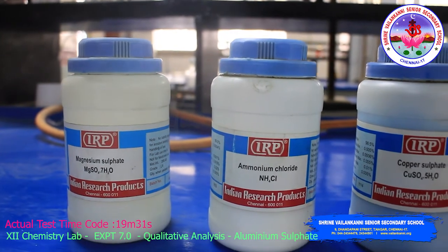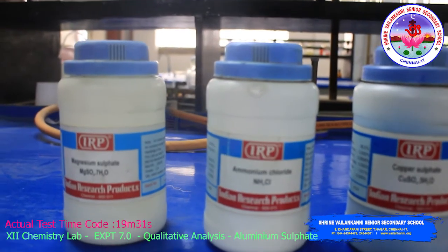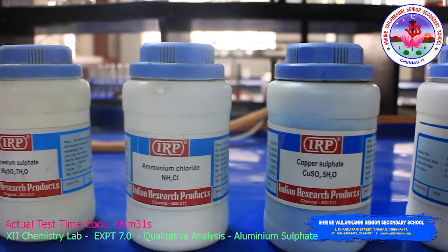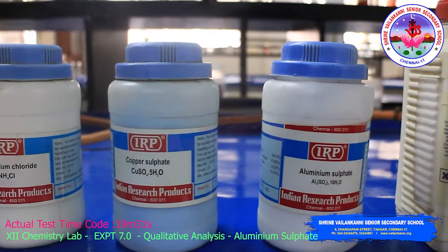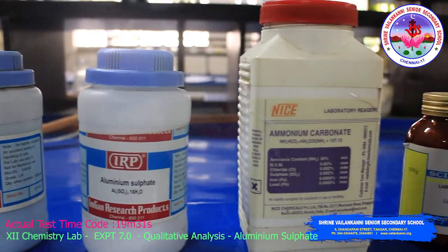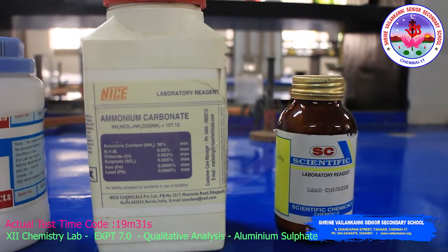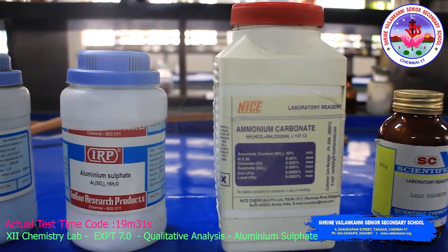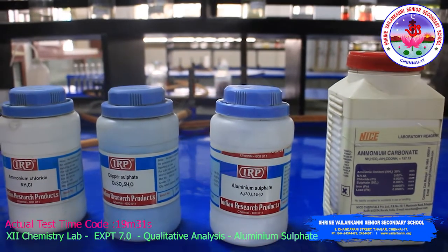Here we are going to do these salts this year: magnesium sulphate, ammonium chloride, copper sulphate, aluminum sulphate, ammonium carbonate and lead chloride. These 6 salts we will do the confirmation tests for here, but you have to do the systematic procedure. I will show you the confirmation tests for these substances.